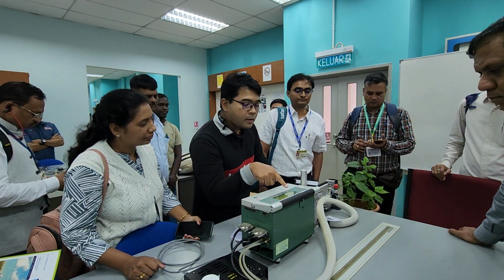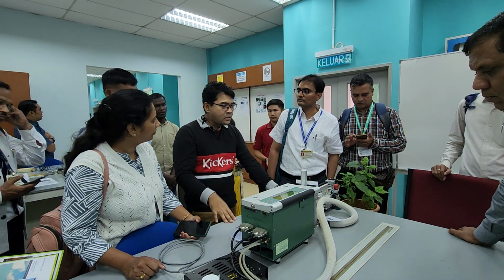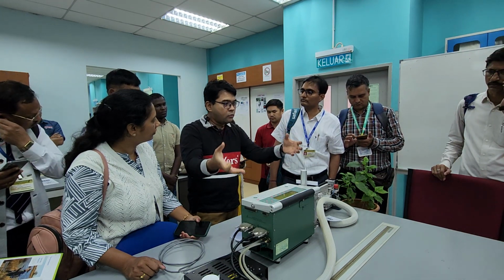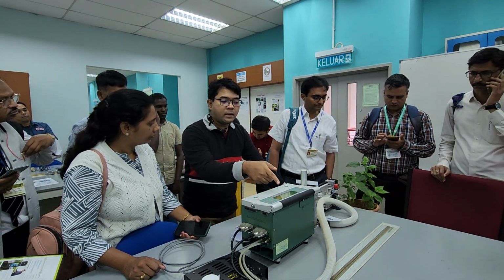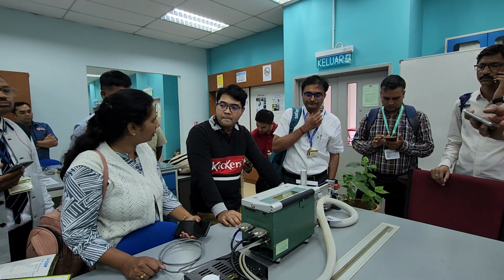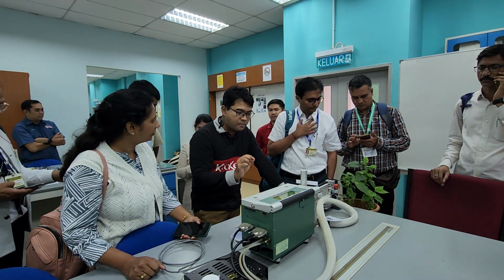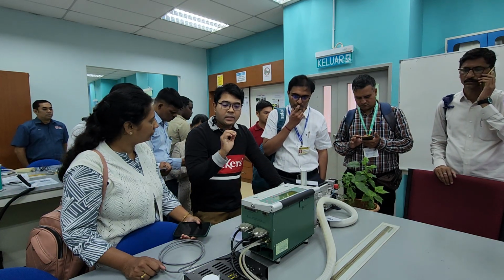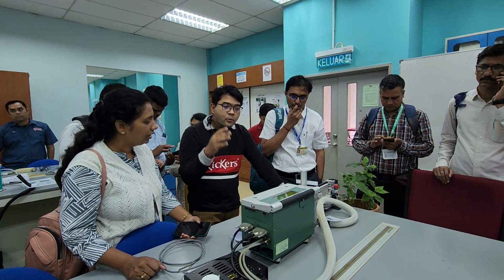So if it's negative, it does not mean your plant is unhealthy. It means the plant has more CO2 released than it is using for assimilation. If you're taking the reading and suddenly it's negative, it means the mitochondria is more active than the chlorophyll, with less efficiency for CO2. That needs to be looked at further. We don't simply make a judgment very quickly. It gives you the reading, but it's up to the user to do the biological interpretation. That's why you need a plant physiologist.